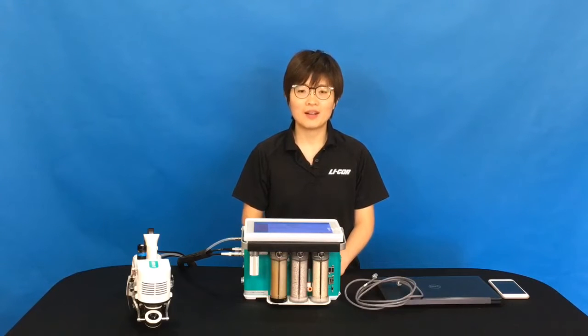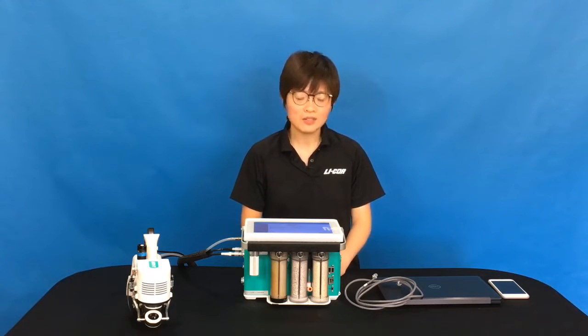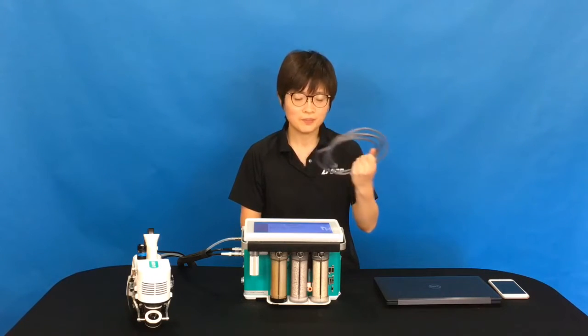Today, I'm going to introduce a useful solution for people who would like to demonstrate their LI-6800 in a classroom or in a training setting, or if you would like to control your LI-6800 in a remote location. For this application, the only tool you need is an Ethernet cable.